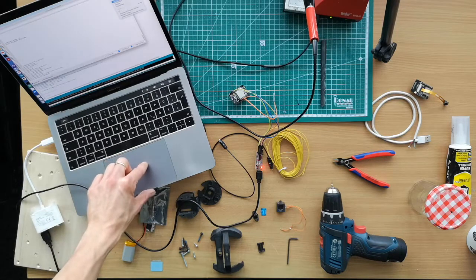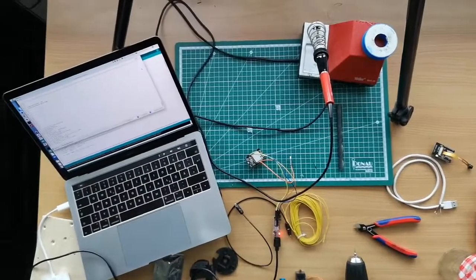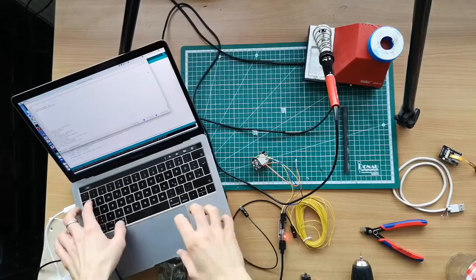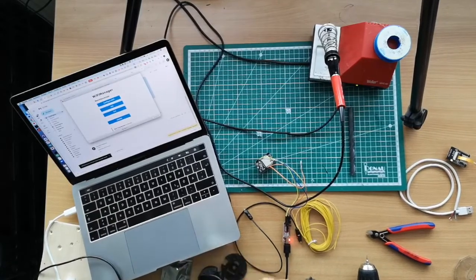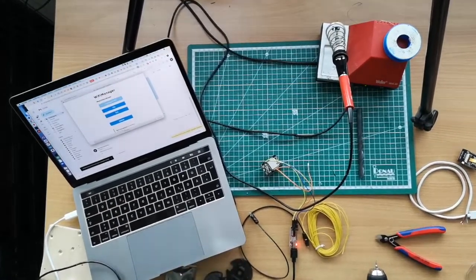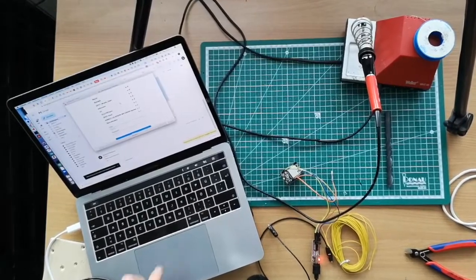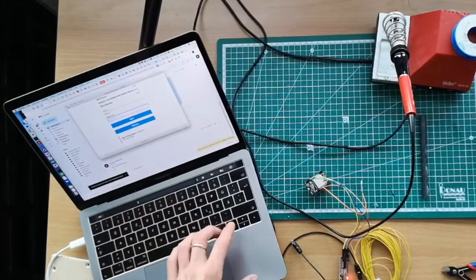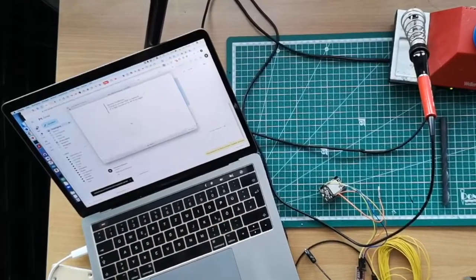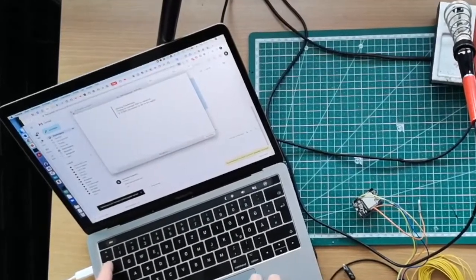And so then you just look for Microscope in your Wi-Fi settings, and then you directly find the according network, and then you go to your browser, and the captive portal will tell you to connect to your nearby network. So it will search for nearby networks. So for example, you can create a network from your cell phone. In this case, again, it's Blink for some unknown reason, and then you enter 12345678. In that case, it's just the password we use for development, and then it automatically will connect to that SSID.